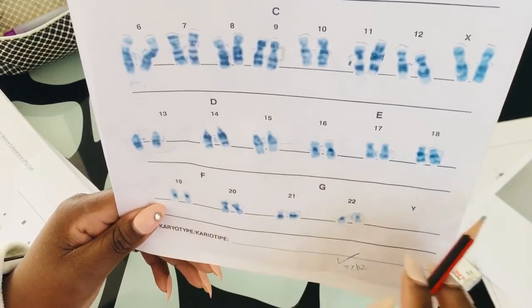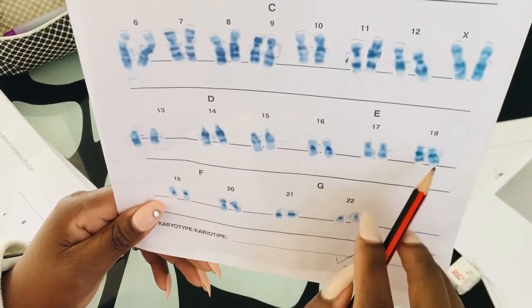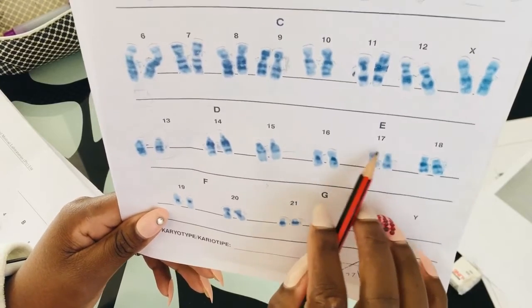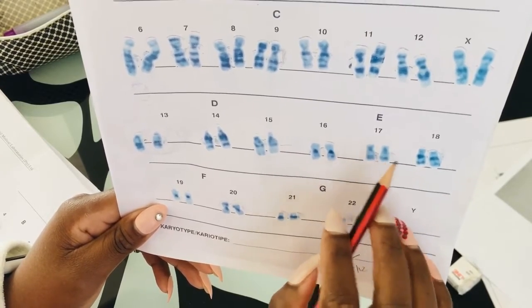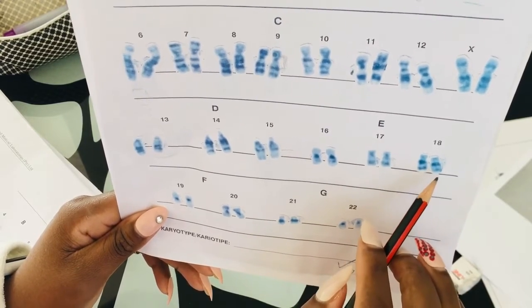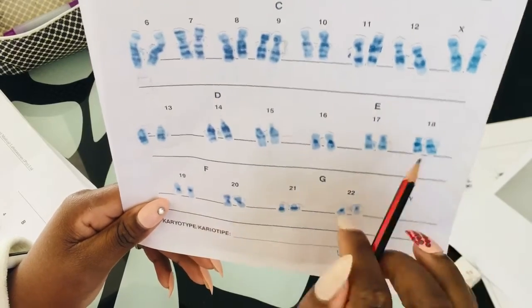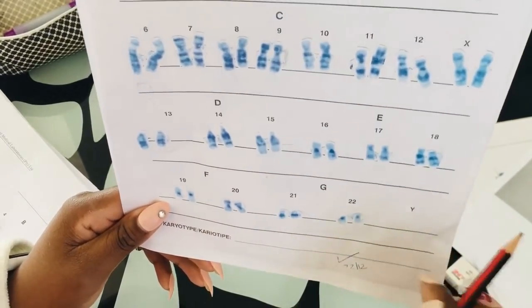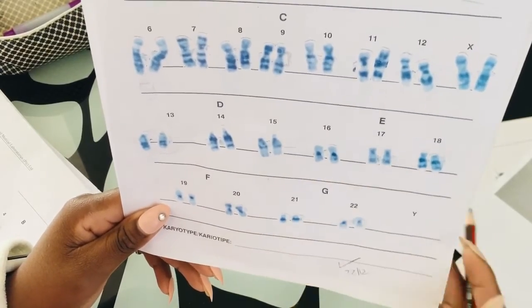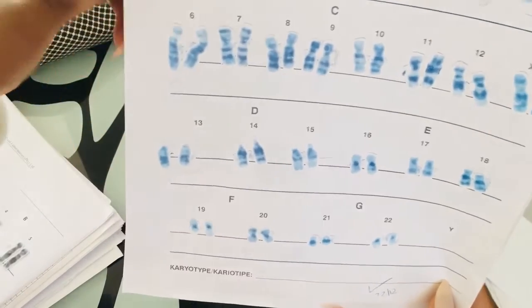And also the intensity, I don't know if it's just coming from the staining, because I think this is a Giemsa stain. But in terms of the intensity, you will see 17 looks not as bright as your chromosome 18. You see, the bands on chromosome 18 are dark and popping and making it obvious, like, hey, we really belong to chromosome 18. We really are chromosome 18. But chromosome 17 bands are a little bit lighter.